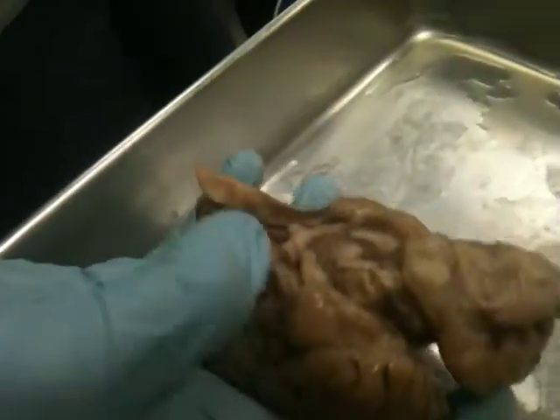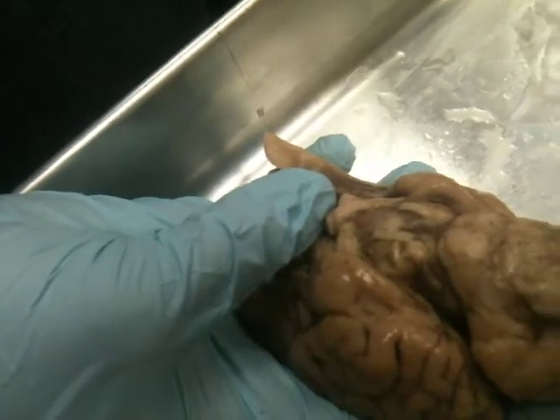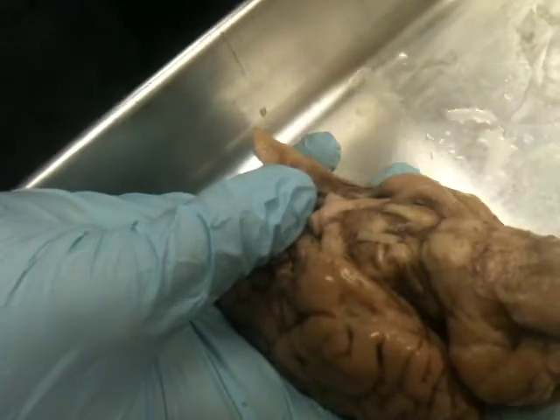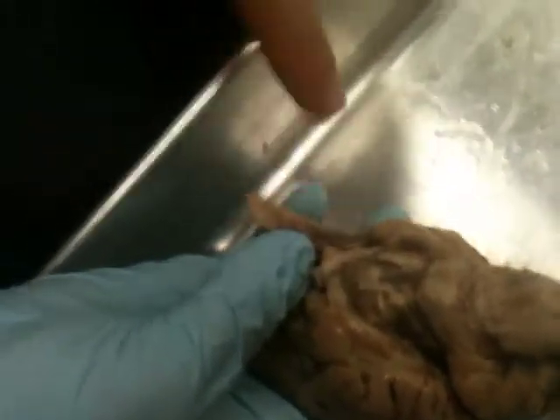Let's see if we can see it on here. So there it is. See how it makes like an X? That's what chiasma literally means, an X or a cross. It's where the optic nerves cross each other. So the nerve coming out of the left eye crosses and goes to the right hemisphere, okay, and then vice versa. So that's where they cross.